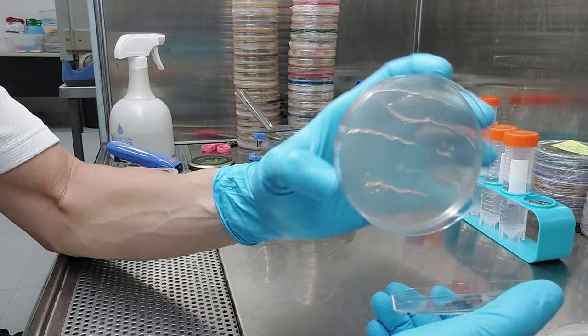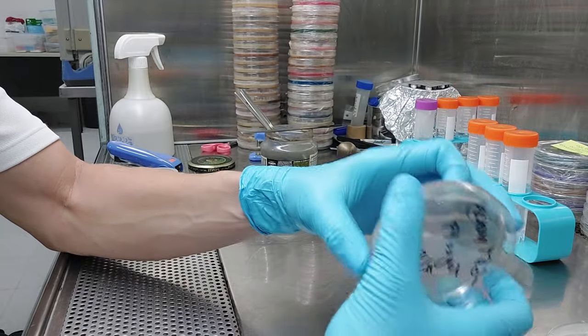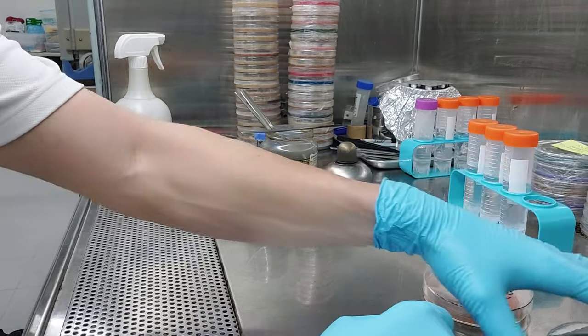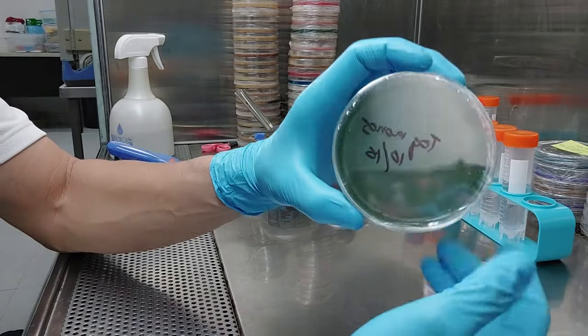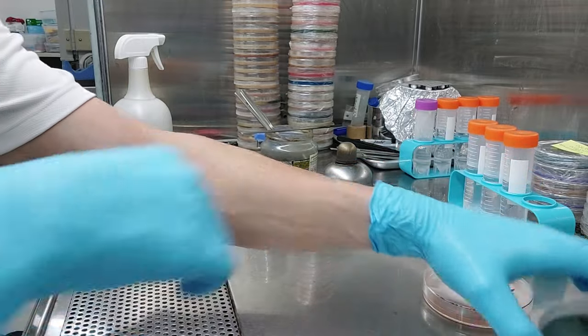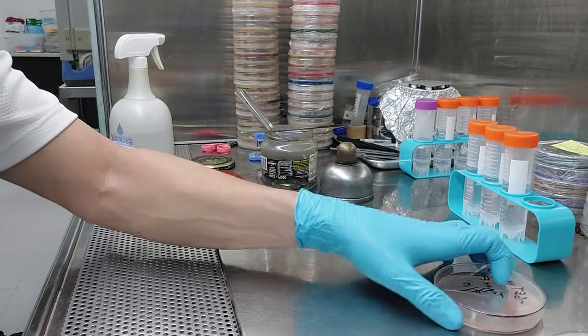Although I've probably contaminated this plate now by spitting all over it. What I'll likely do, since I already have a good toque F8 isolate, I'll probably just use these for the monos. If I don't get a mono, I'll just try it again.